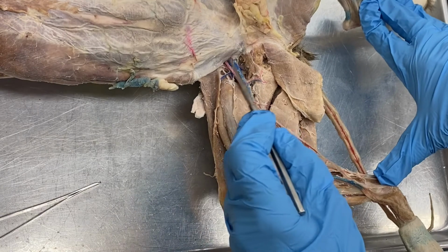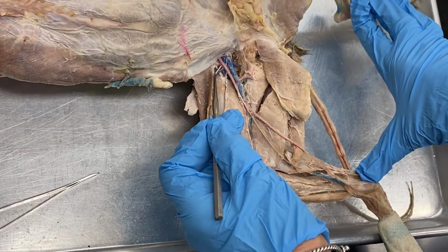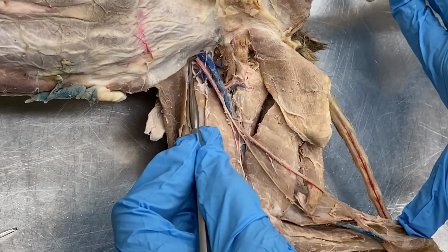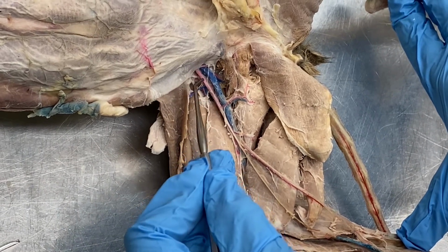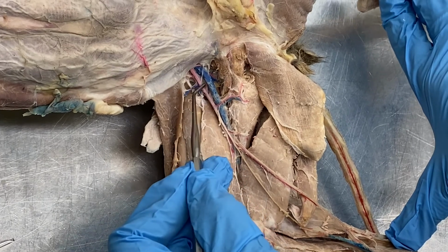In this video, I want to show you a few appendicular vessels. So you should be familiar with the femoral triangle. This is the femoral artery, and in the human, looks very similar. In the human, actually, the external iliac gives rise to the femoral artery just past the inguinal ligament.